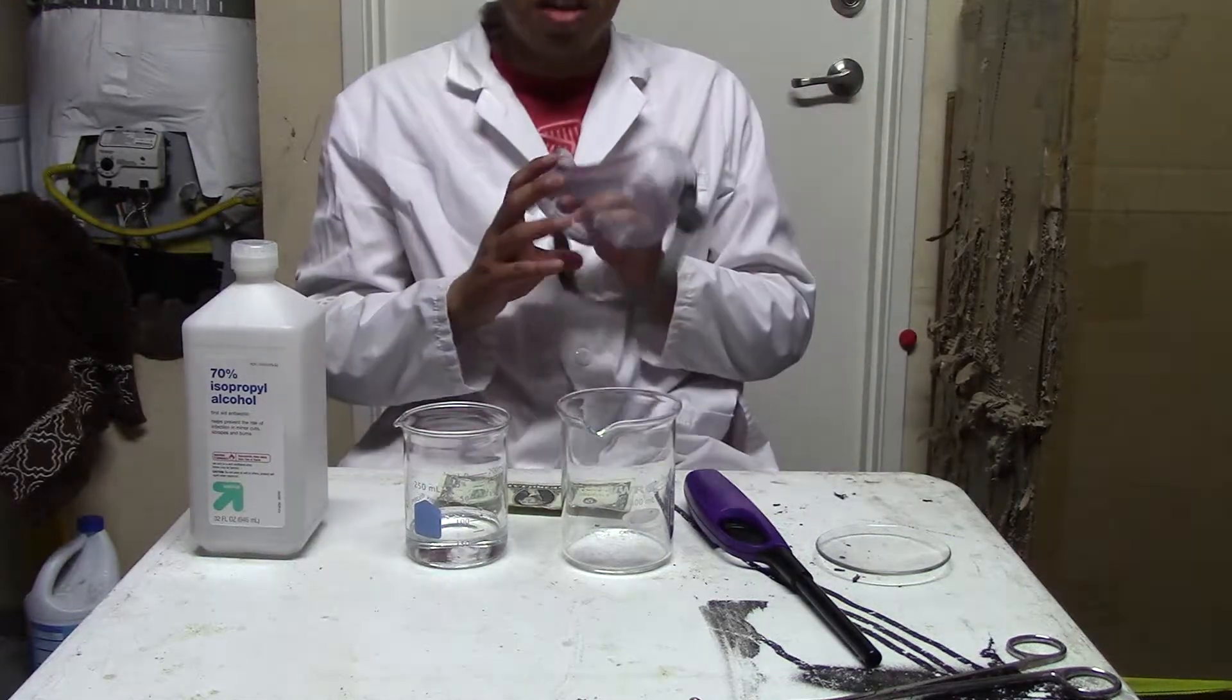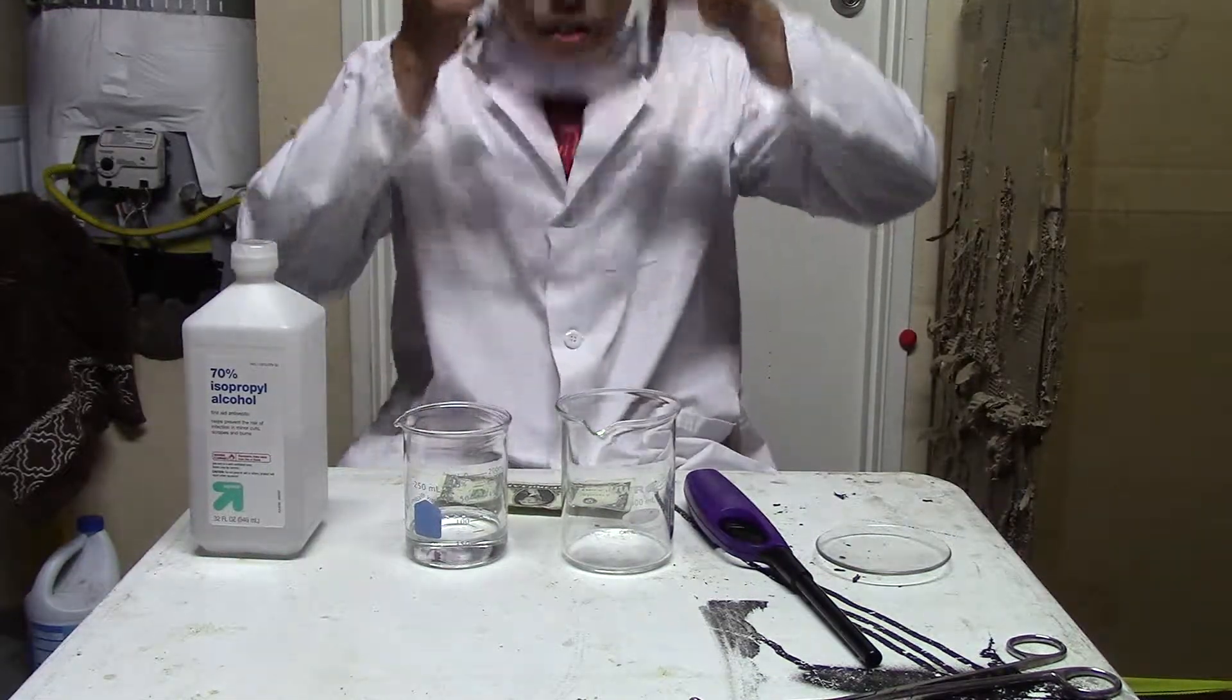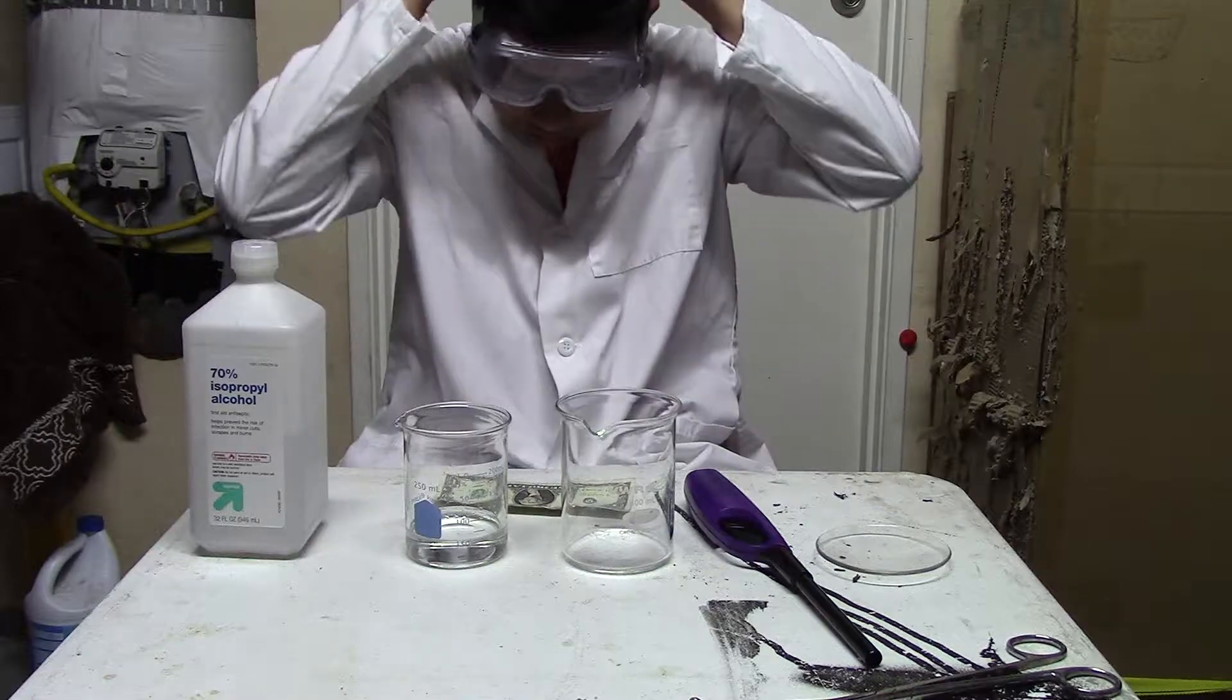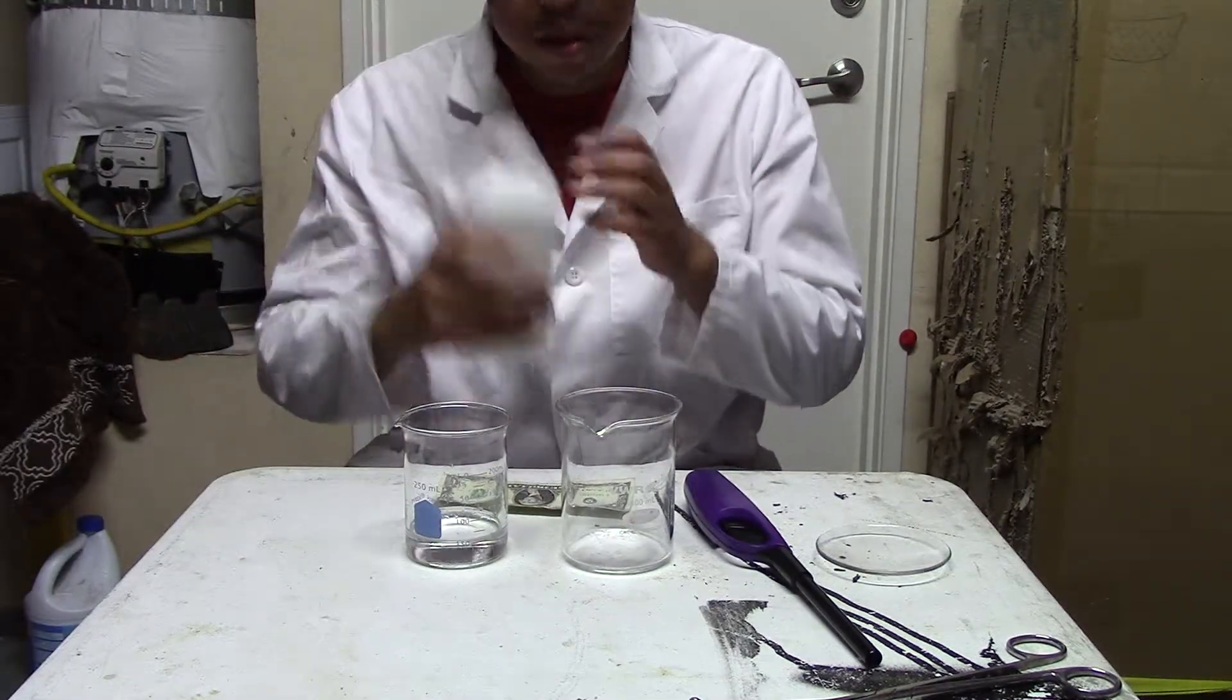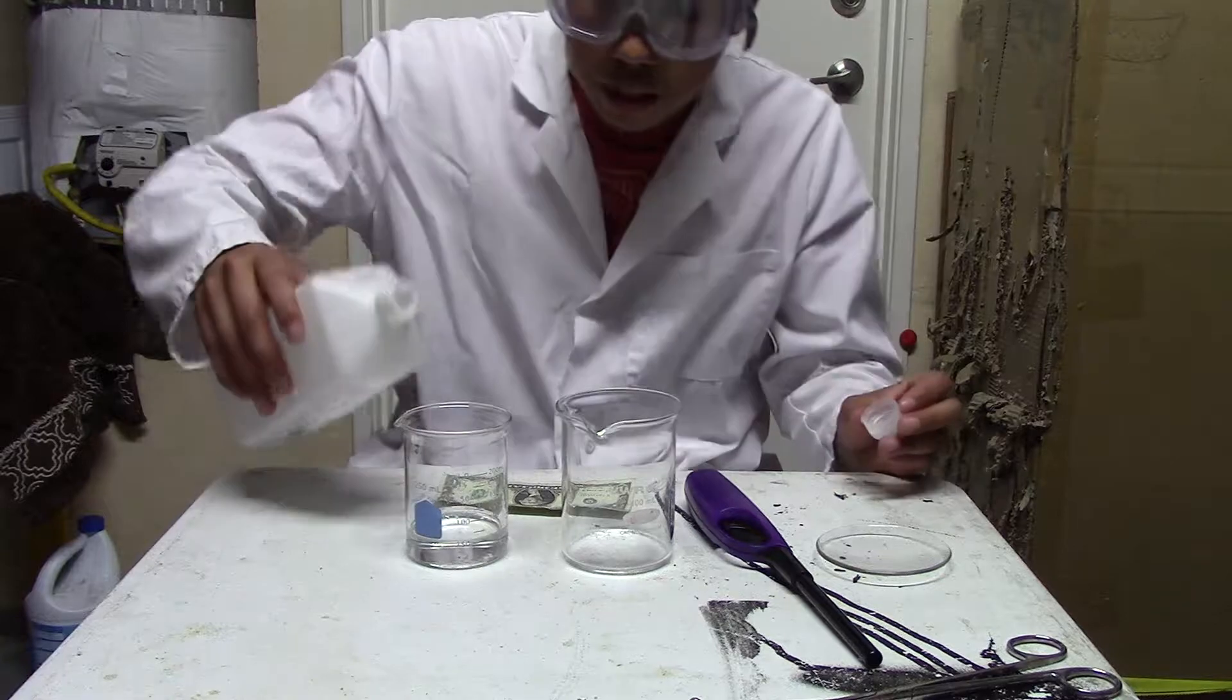So first things first, safety always comes first. You're going to have to wear your goggles, pour some isopropanol into the 250 milliliter beaker.